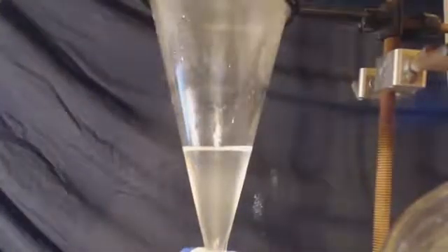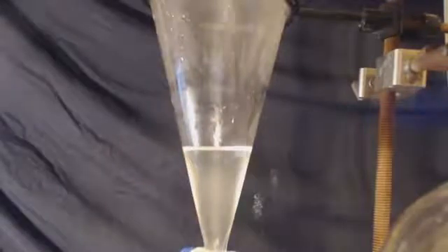Now, I'm going to put the ethyl bromide back into the separating funnel. This time, I'm going to add some sodium bicarbonate or baking soda, and just in case any sulfuric acid is in there, it'll get rid of it. Shake it up, let it sit 20, 30 minutes. And you can see, ethyl bromide is real volatile, so when I'm letting it sit, I put it in an ice bath. So anyways, I drain out the bottom layer, which is what I want. Top layer, I discard.